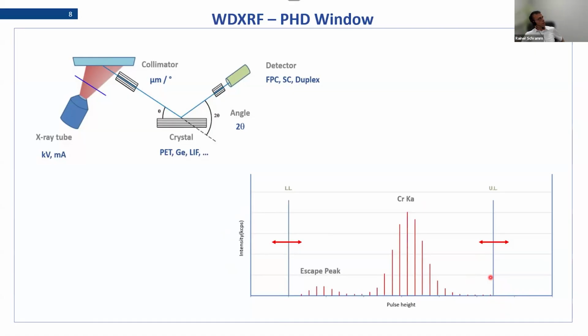But there are three elements, titanium, vanadium, and chromium, which are a special case in combination with a flow counter, where you also have an escape peak. And then you have to make sure that your lower limit is either on the left side or in the middle of this escape peak, because very often the standard setting of the software is just on top of the peak, and this is also not good for our long-term stability. We want that when this picture moves a little bit from the left to the right, everything is still collected inside the limits. And this is why you have to make sure that the lower limit and upper limit are really set in a way that the whole picture is still collected.